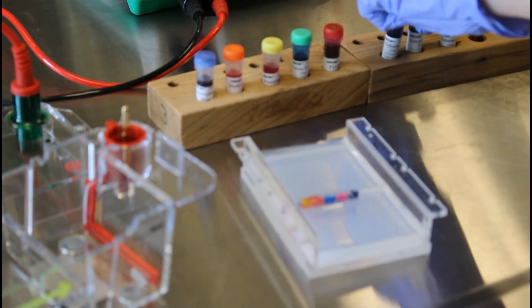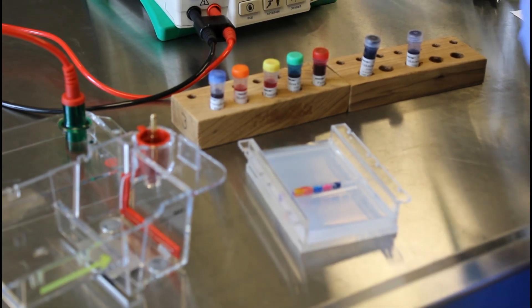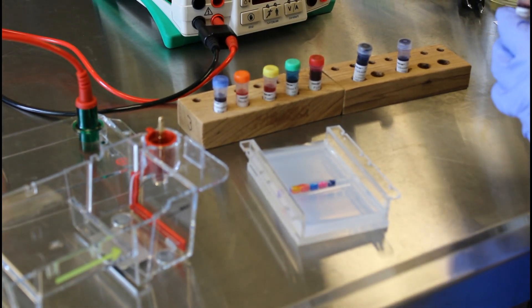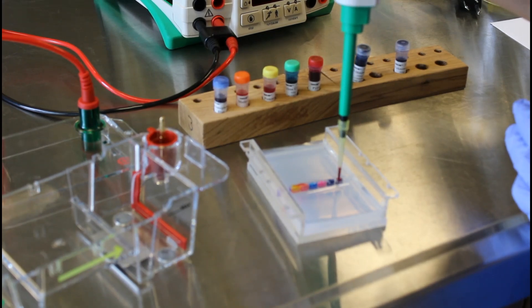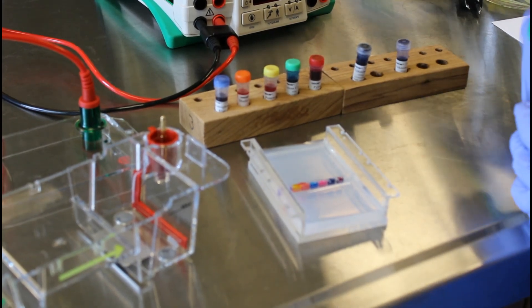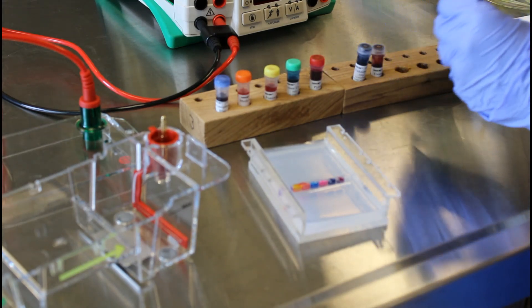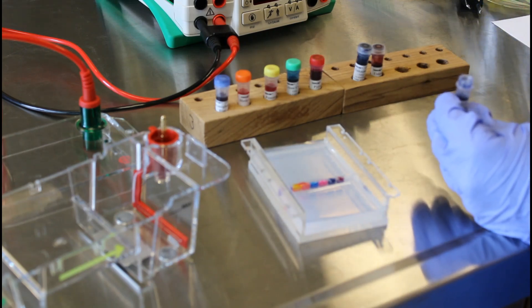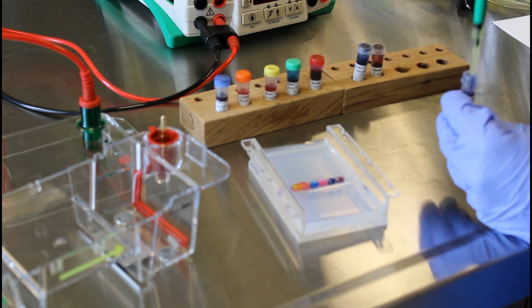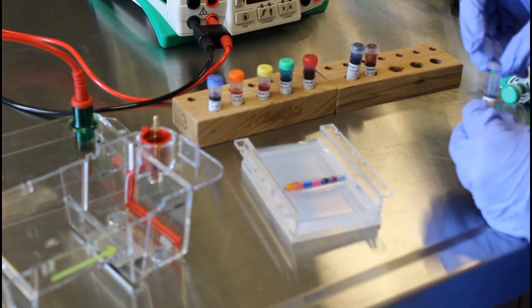Then we're going to load up our unknown two. Discard that tip. And then finally our third unknown dye is going to go in this last well over to the right. Okay.